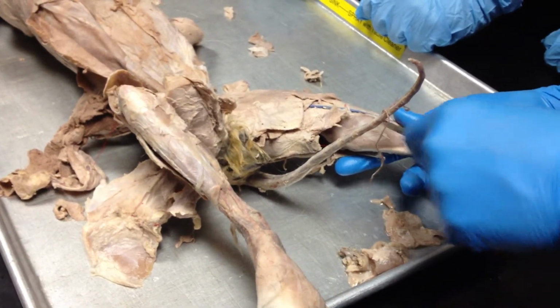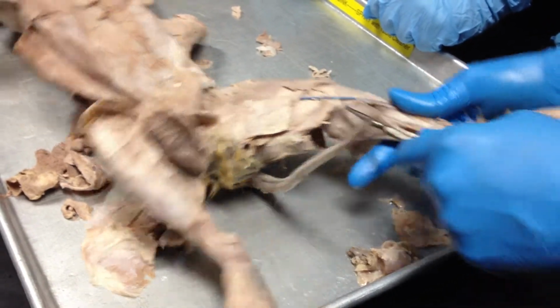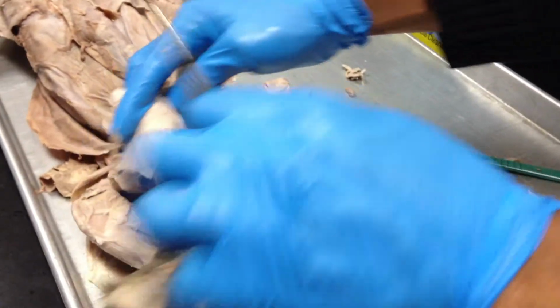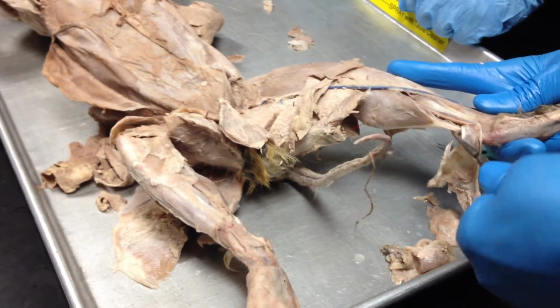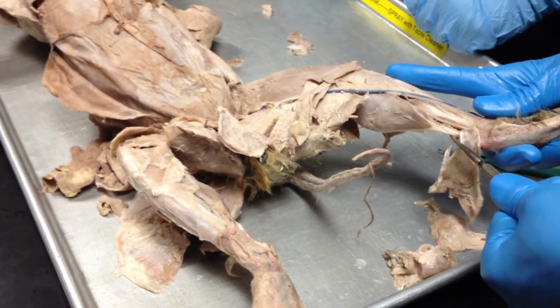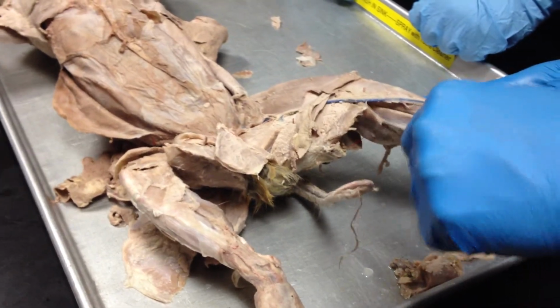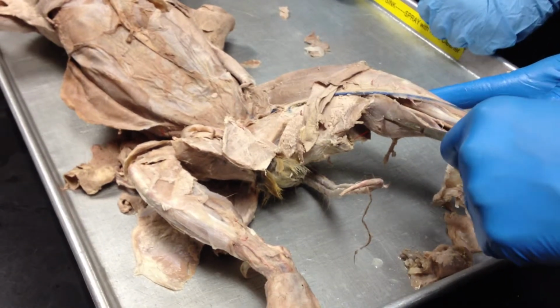And these muscles, the triceps surae, which includes the two gastrocnemius heads, that's the medial head, and then you have the gastrocnemius lateral head here. And the soleus, these combine and attach to the calcaneal bone here. And this is the Achilles tendon. Which one's the soleus? The soleus would be deep below, so this muscle here. The long one. Okay. It is flat right under the gastrocnemius.